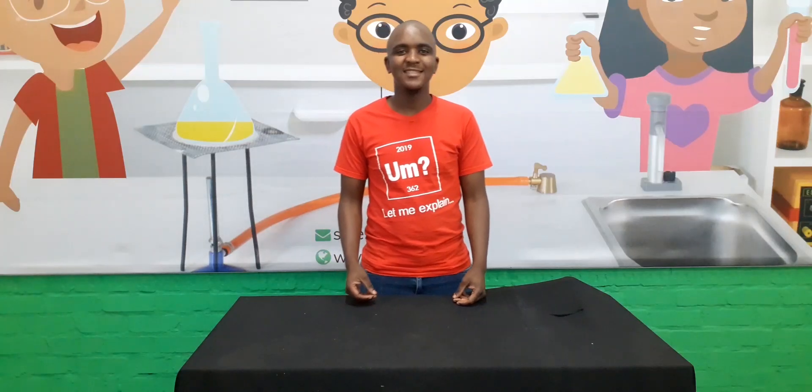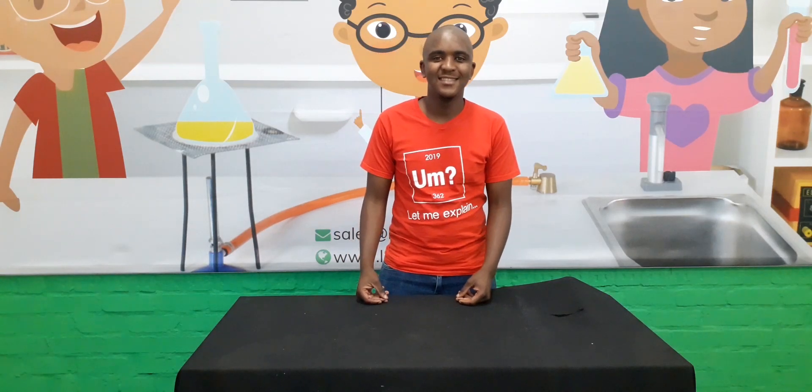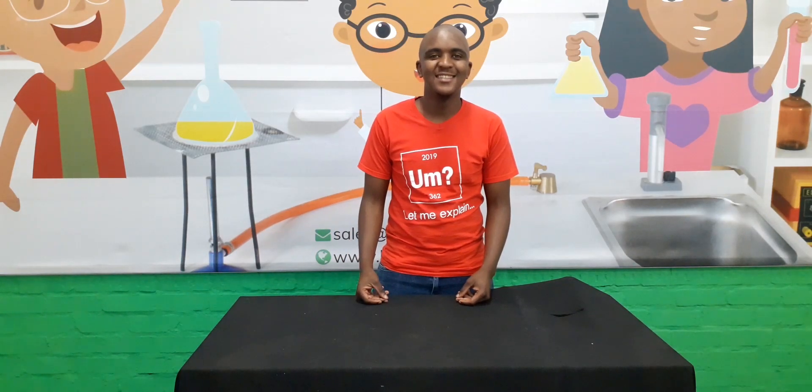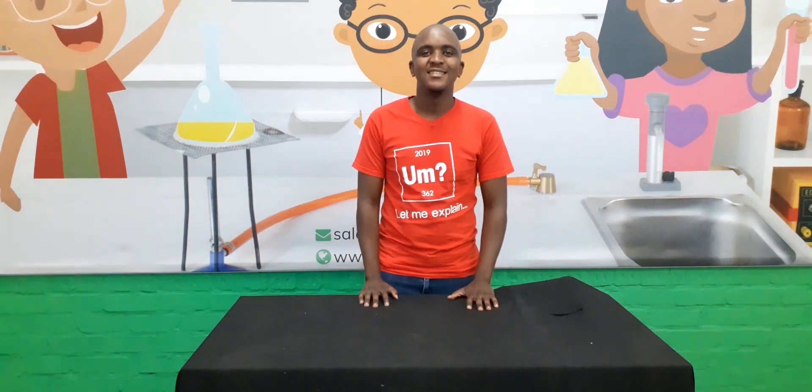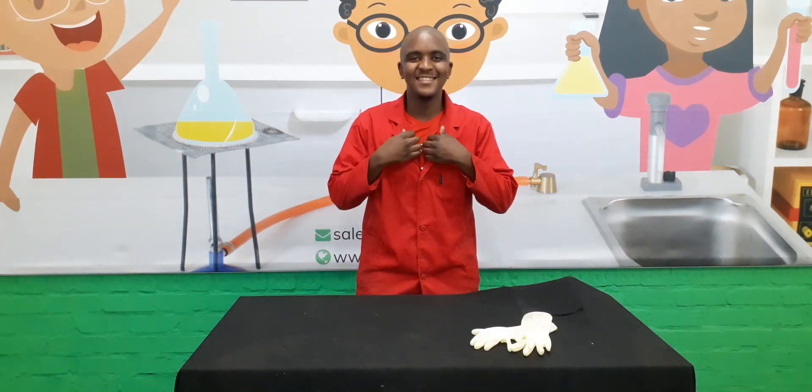As always, before we can begin, we need to get our safety gear for this experiment. So for this experiment we'll be needing a lab coat and a pair of gloves.